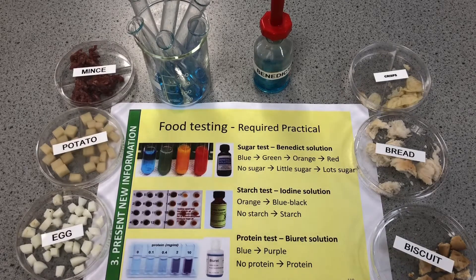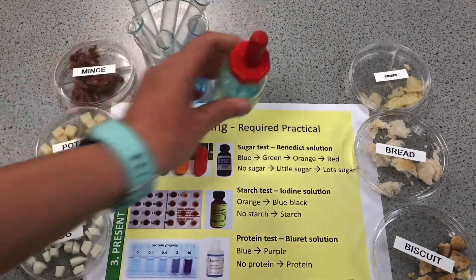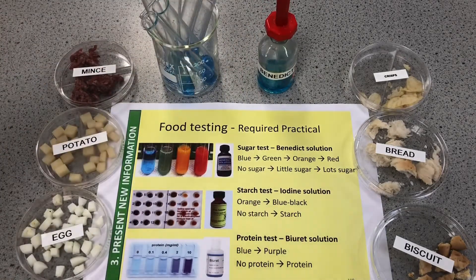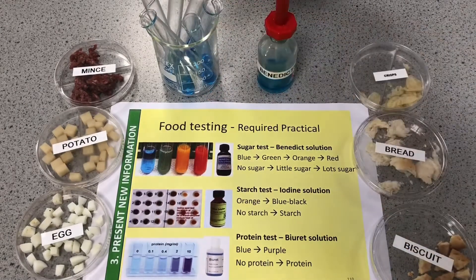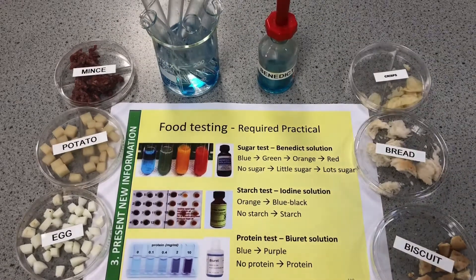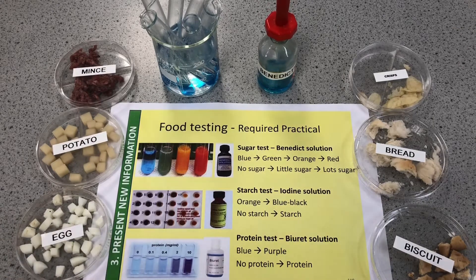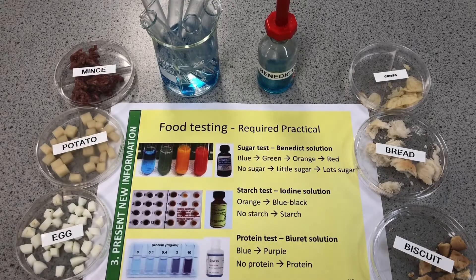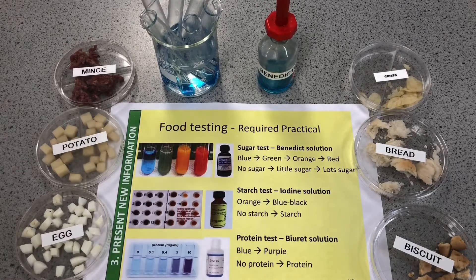We're going to start off with the Benedict's test — this is the sugar test. Benedict's solution starts as this nice turquoise color. I've already put it into these tubes in a beaker. I've just boiled the kettle because it is heat activated, and this is a good one to set up first because it takes quite a long time to work. The hot water surrounding the chemicals is acting as a hot water bath.